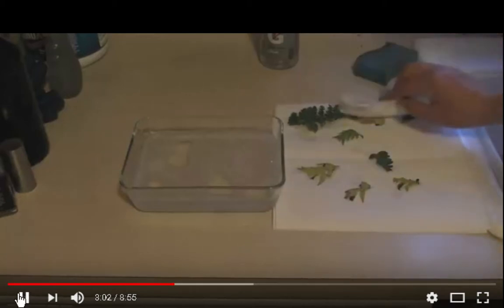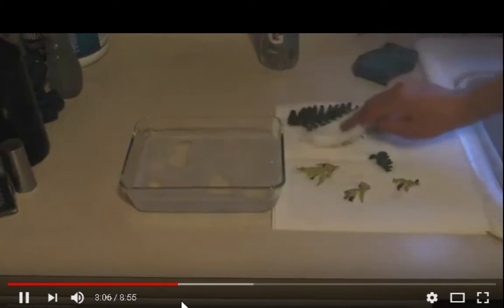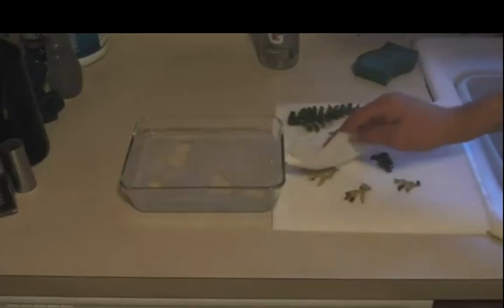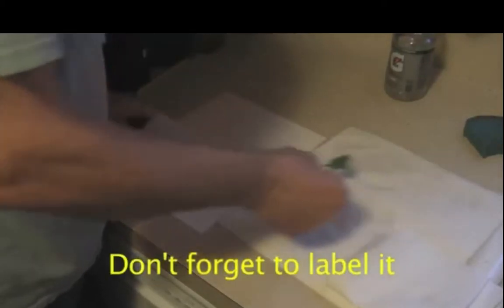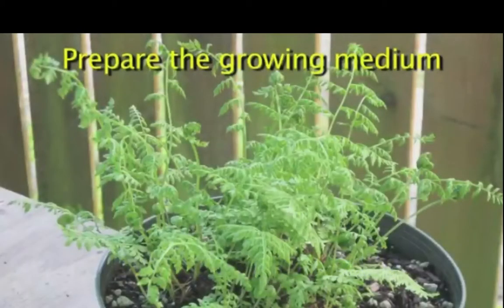That's a 1 to 10 dilution. I leave it in there for about 15 seconds. I take it out, put it on a clean paper towel, and blot it more or less dry. The fronds are then placed between 2 sheets of printer paper and allowed to sit for a few days in a draft-free place. The spores will drop off and stick to the paper, and then we can use them in the next step. I didn't sterilize my first group.